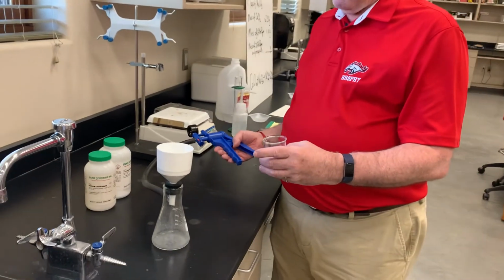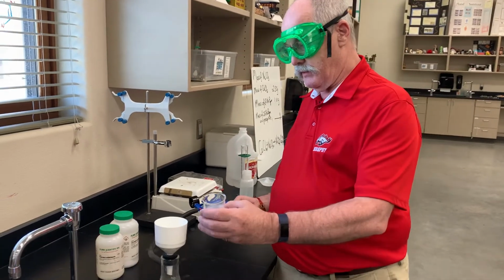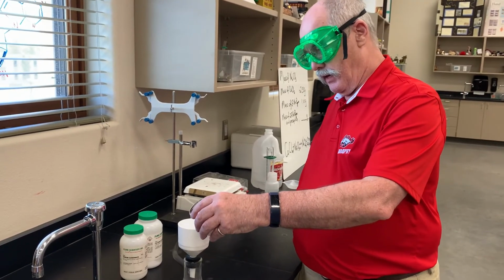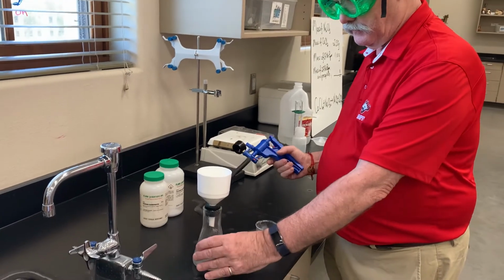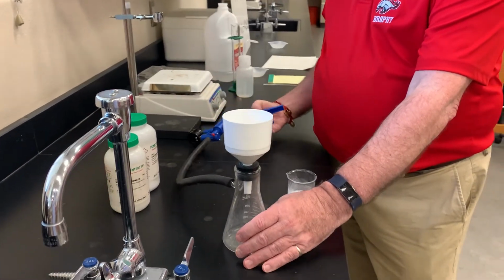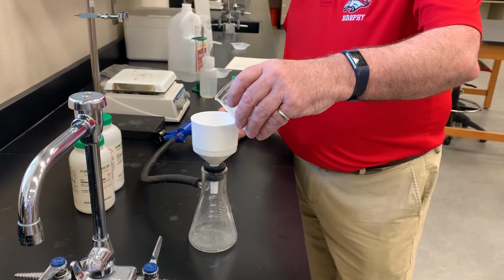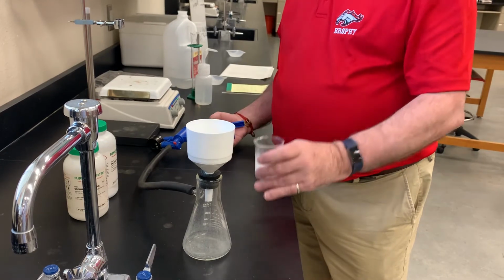Normally, or a couple of years ago, we used to run this using water the whole time, and using this hand pump, we're saving the environment and not using nearly as much water. And you'll see that as it comes through really, really fast. And we add this slowly so that we don't have any of it go over the sides.